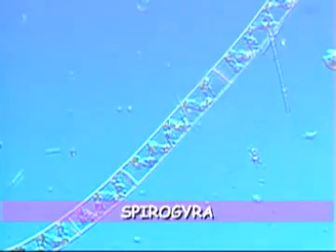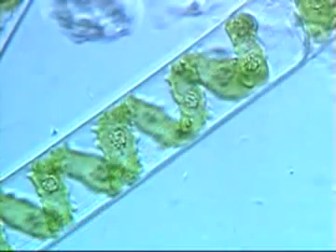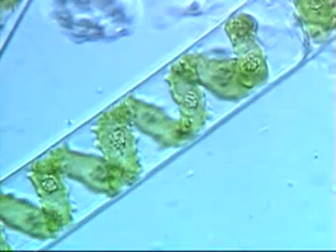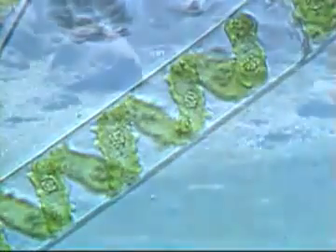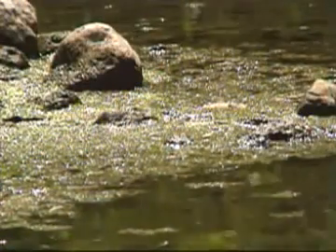The cells in this colony move by sliding back and forth. They resemble a carpenter's folding ruler. The cells in other colonies form long strands. This one is called SPIROGYRA. It gets its name from the spiral structures filled with chlorophyll. While pretty to look at under the microscope, large masses of it form the green, smelly substance we refer to as pond scum.